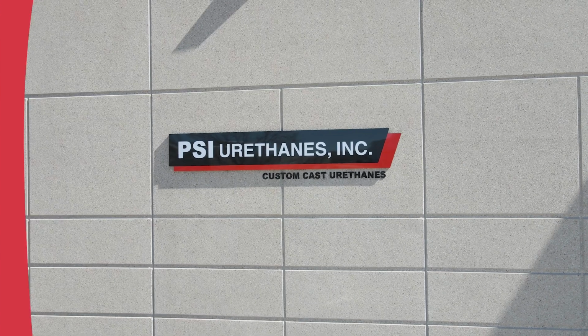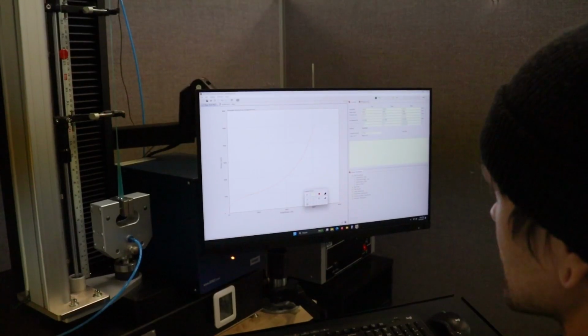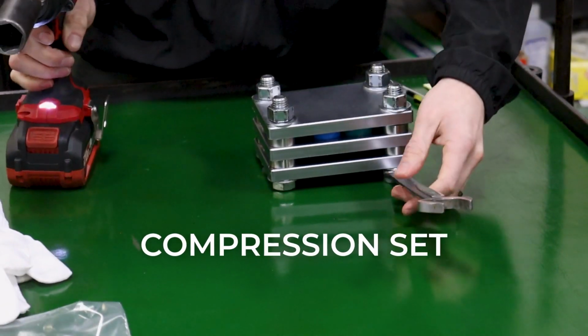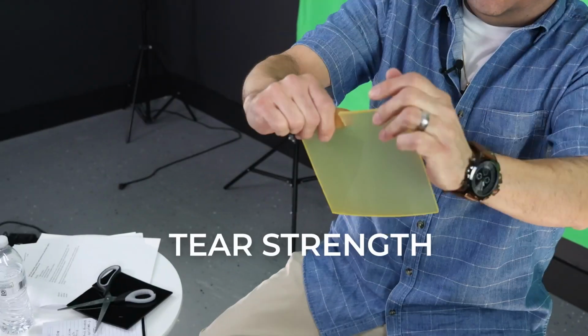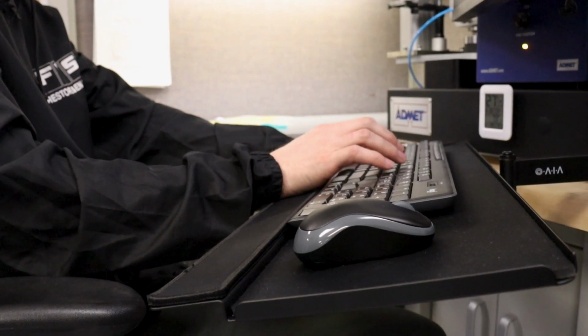At PSI Urethanes, we use a variety of testing methods following ASTM standards for a plethora of different data readings. We capture data such as ultimate tensile strength, elongation, compression set, rebound resilience, durometer, and tear strength. Essentially, an ASTM is a collection of data testing standards used across the board. Typically, if a customer has a requirement for hardness or rebound or compression set, there are specific ASTMs for each one of those data sets, and we collect that thoroughly and extensively for our spec sheets.